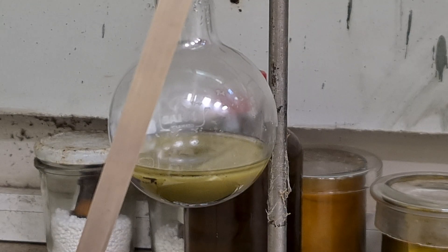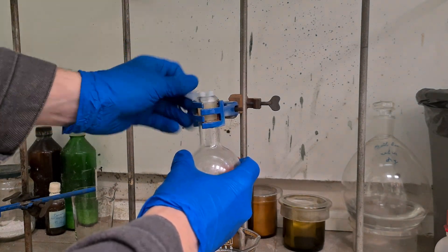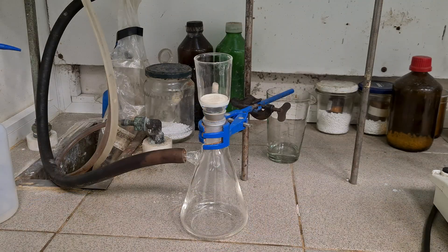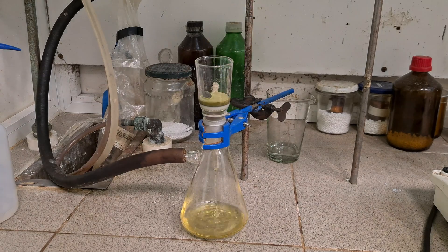On the next day, I have just removed the condenser and filtered off all precipitate on a glass filter. Hey, do not throw away the benzonitrile. It can be distilled and used again in the same synthesis.